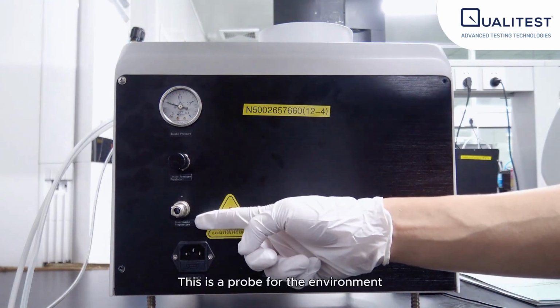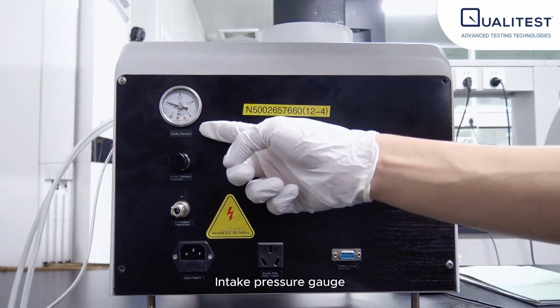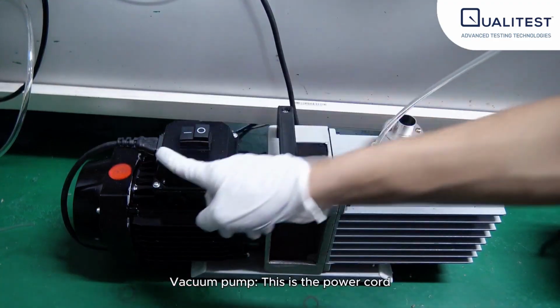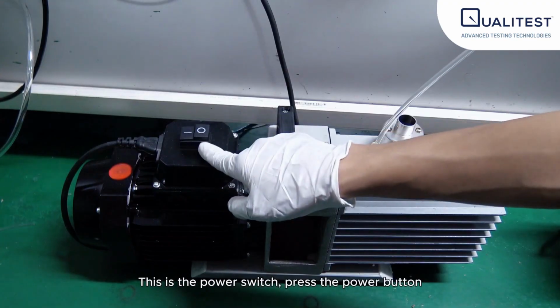This is a probe for the environment. This is air supply pressure regulator, intake pressure gauge. Vacuum pump. This is the power cord. This is the power switch. Press the power button.